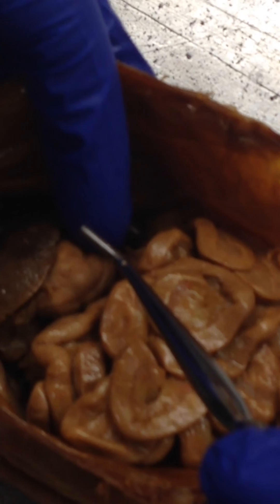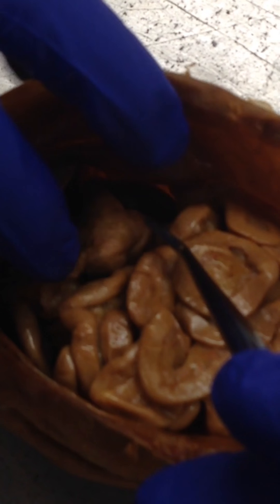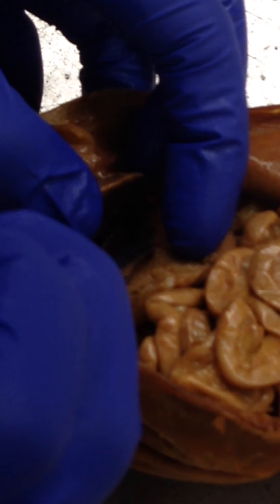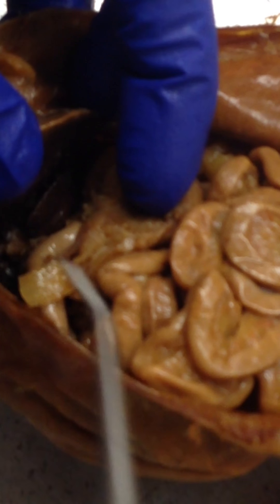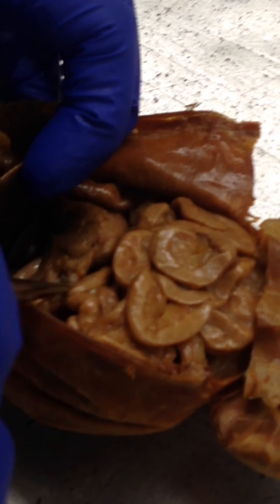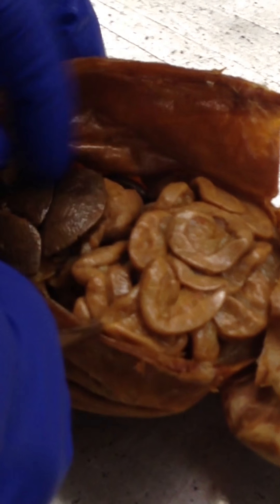The greater omentum looks kind of like spiderweb-looking stuff — it would be right over here between the stomach and spleen, but it's been ripped off this specimen. The lesser omentum is by the lesser curve, and you can see the spiderweb-looking stuff way down here, but it's not very obvious. So you'll just have to know where it's located. Here's the stomach and then the liver is right here.